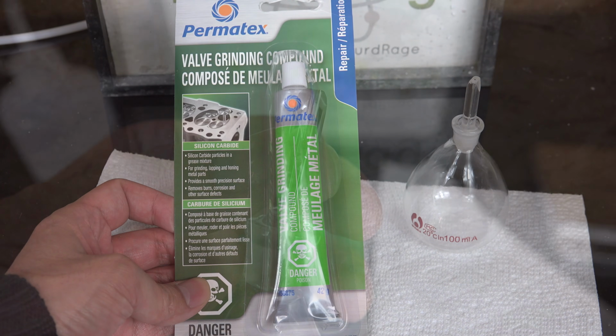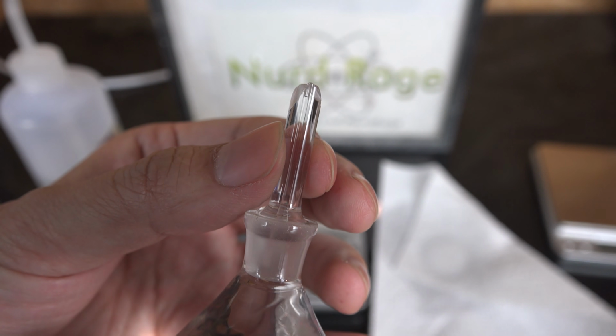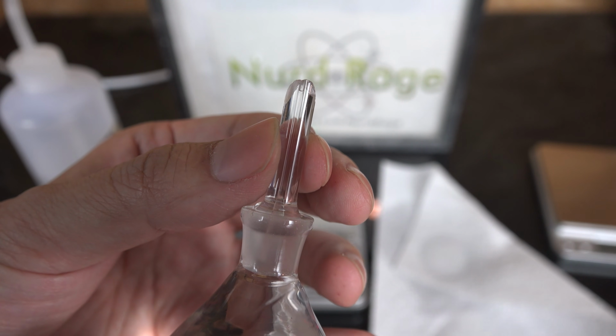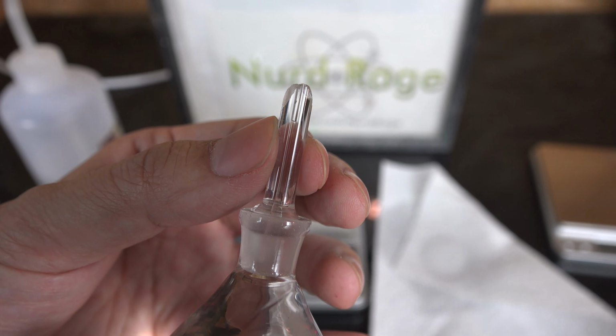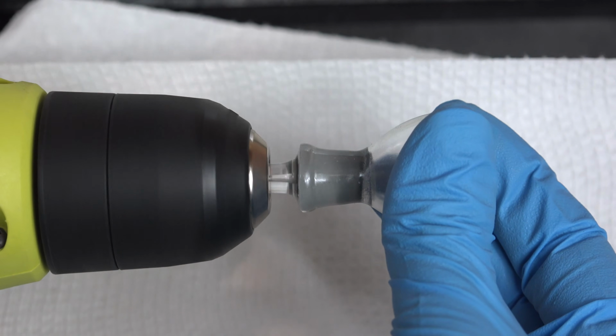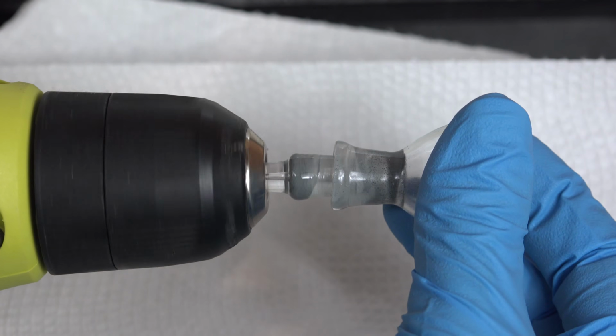But I'm not sure if I would officially recommend doing it for the amateur, because even this wobbly unground unit had less error than a 10 mg scale. You'll get more error from your hand heating up this sample and altering the density. Nonetheless, if you're a perfectionist obsessed with maximizing analytical quality, grinding is an option.